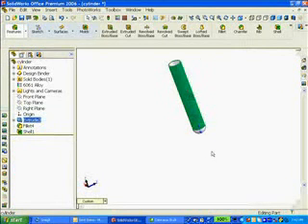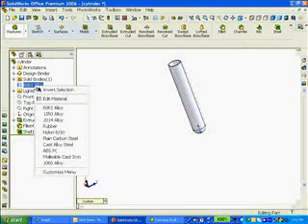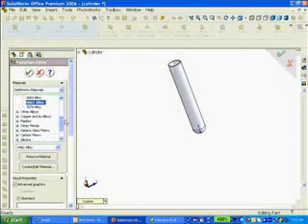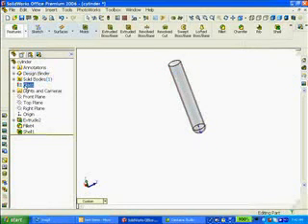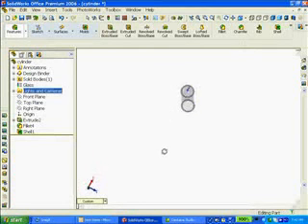Currently, our material is aluminum, but that doesn't make much sense when our test tube is going to be made out of glass. So I'm going to right-click on the aluminum alloy, select Edit Material, and from my list, come all the way down to the bottom and select Other Non-Metals. Glass is one of the options. So I will click on glass and say OK. Glass has been modified and displayed in the FeatureManager. It also has given me a transparency.